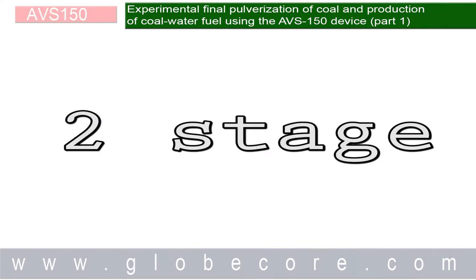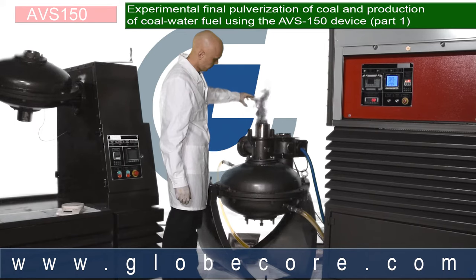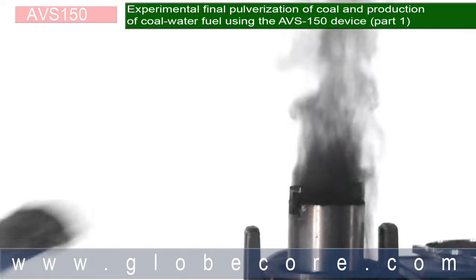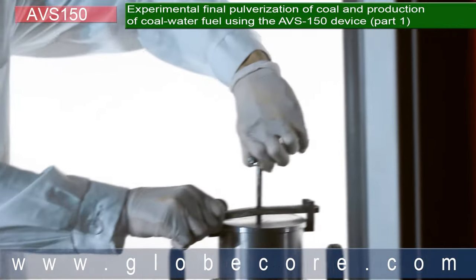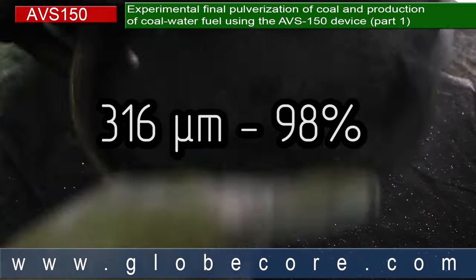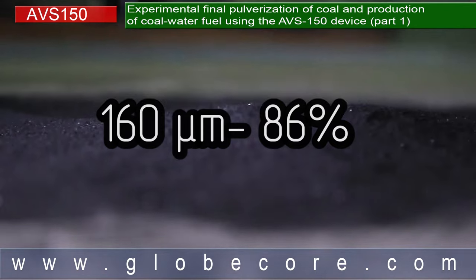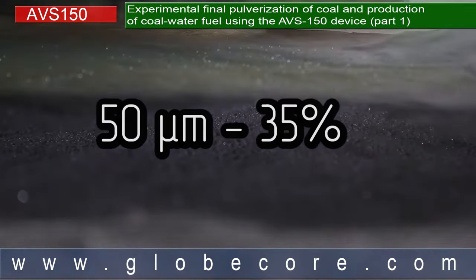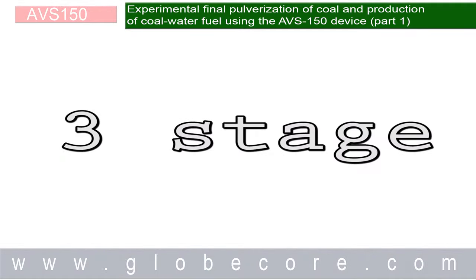In the second stage we pulverized the same 10 to 15 mm coal fraction with water, making the coal water slurry in the process. Pulverization and mixing took two minutes. The results were evaluated with sieves after drying the sample. 98% of the sample passed through the 316 micron sieve, 86% passed the 160 micron sieve, and 35% of the material passed the 50 micron sieve.